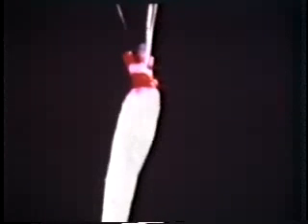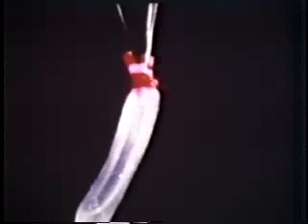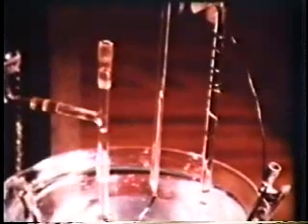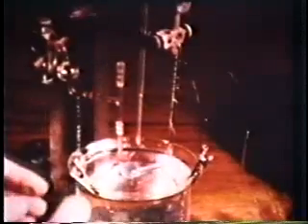During the rolling out process, some of the axoplasm is forced back up into the tip of the cannula. As the pressure builds up, this is forced out of the cannula and travels down the length of the axon as a small plug, until finally ejected. The lumen of the axon is now completely clear, and solutions flow through it with ease.